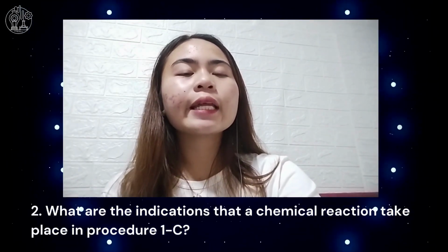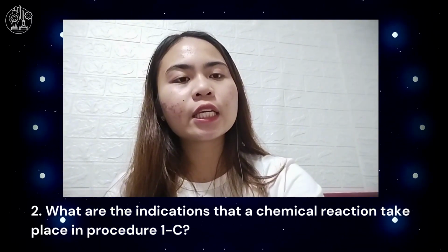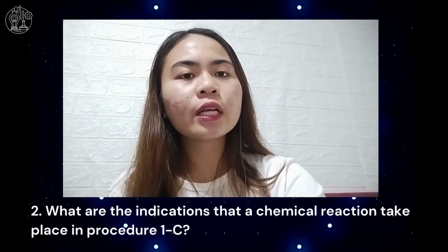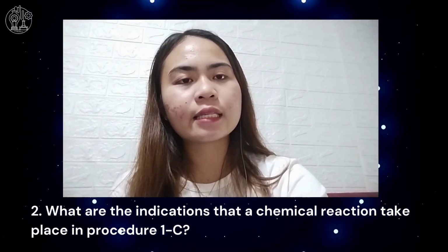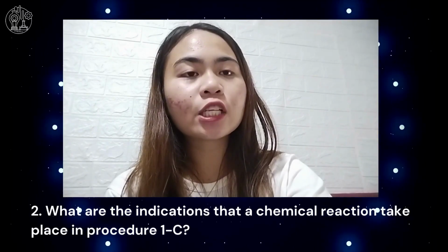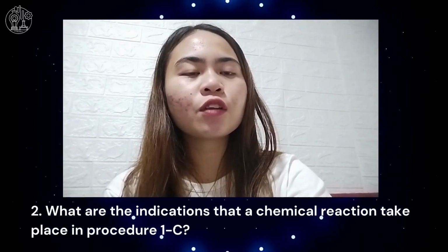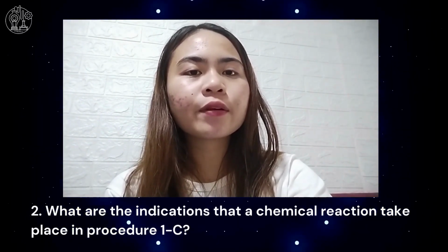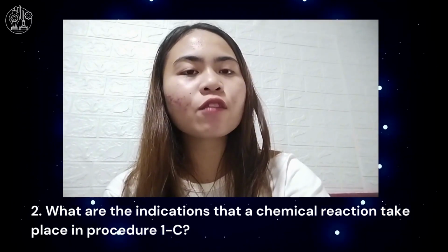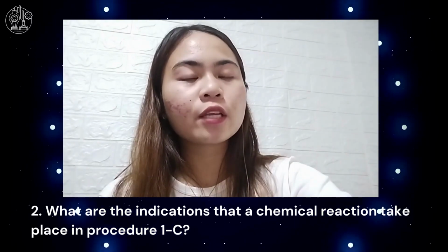Question number 2. What are the indications that a chemical reaction is taking place in procedure 1 to C? Mixing these compounds initiates a series of chemical reactions. Sulfuric acid reacts with sodium carbonate to yield sodium sulfate and release carbon dioxide gas. Subsequently, calcium chloride interacts with the sodium sulfate produced, resulting in calcium sulfate formation, while sodium chloride remains dissolved. Indications of these reactions include effervescence due to carbon dioxide release from the sulfuric acid and sodium carbonate reaction. A white calcium sulfate precipitate forms as calcium chloride reacts with the sodium sulfate, possibly causing a temperature change due to exothermic reactions.